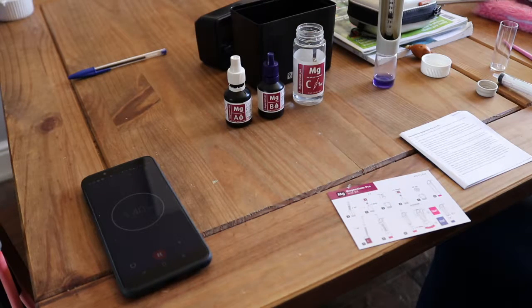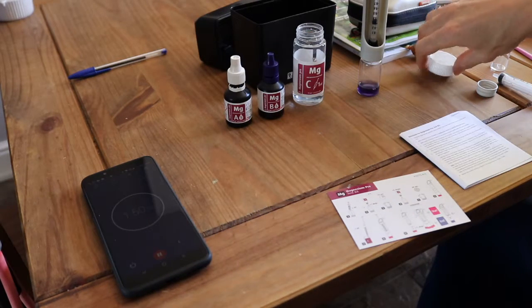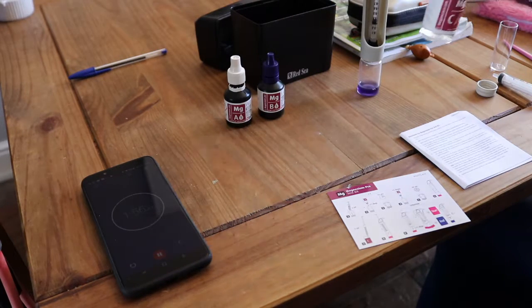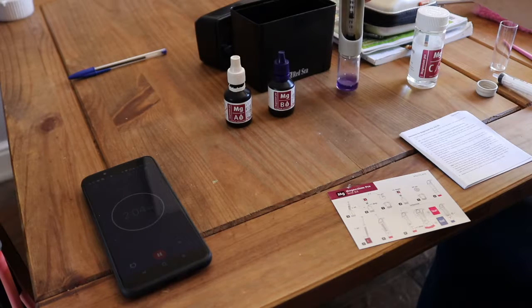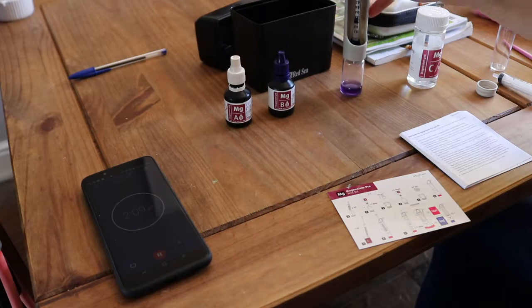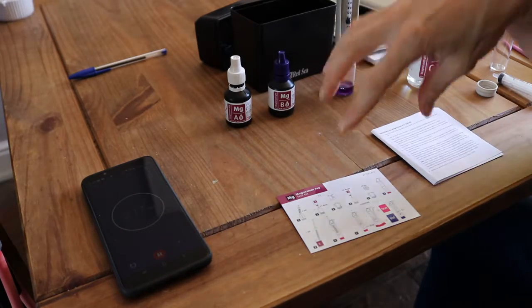So by all means, comment, let me know if you think that this is way off, but from what I've read from the various forums, internet threads, and what Red Sea have told me, that's the way you get the test done. Do your 15 seconds between each drop of A, and then wait 60 seconds after you've done B, and then with this, you drop your first 0.4, you keep going fairly slowly until you get blue for the first time, then you stop. Some people might have found that was all very obvious, but as I said, the instructions aren't right. The manual says some of it, but not all of it. And the YouTube video confirms the stuff that isn't in either.